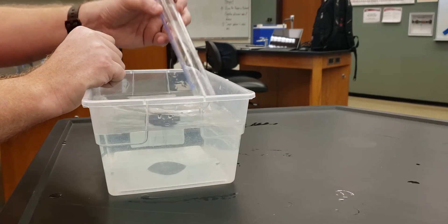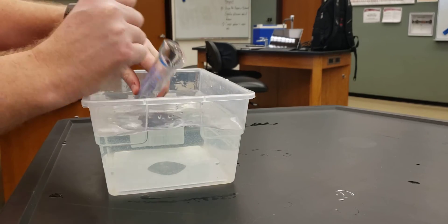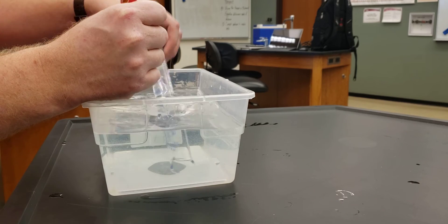If I pull it too high, all my water spills out. So doing the experiment, you've got to be careful and submerge it completely and then keep it there.